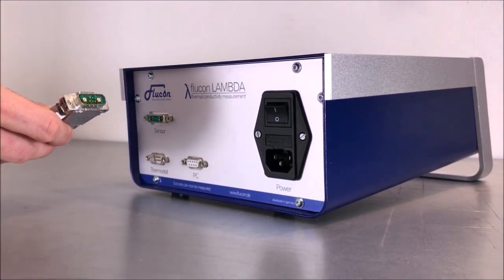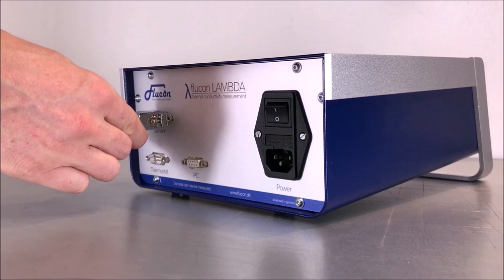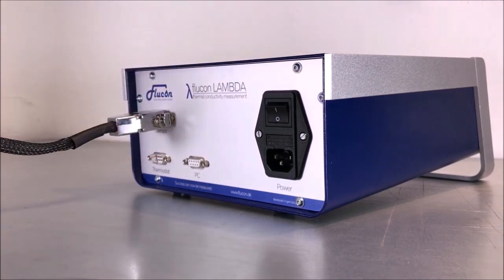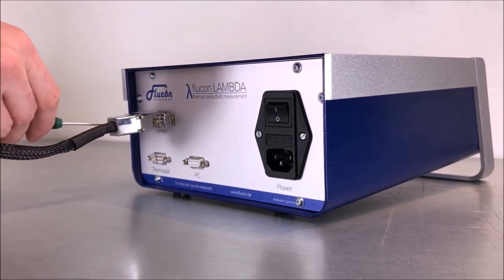First, connect the sensor cable to the electronic box. Use the additional screws to tighten the connection.